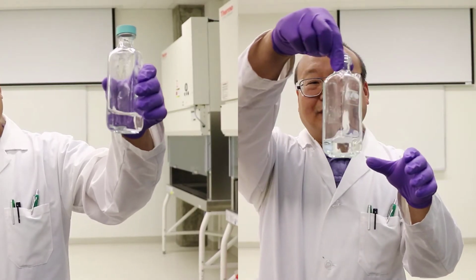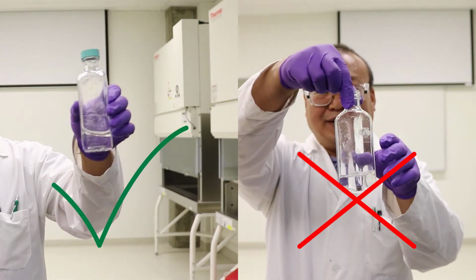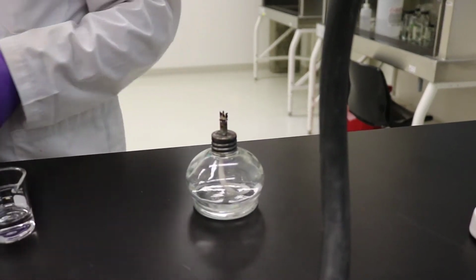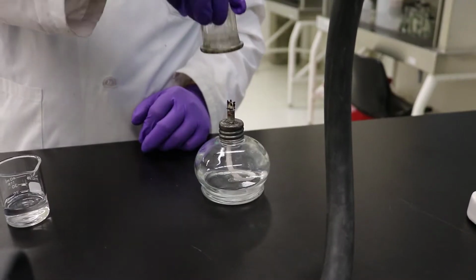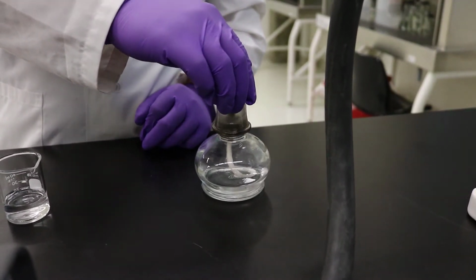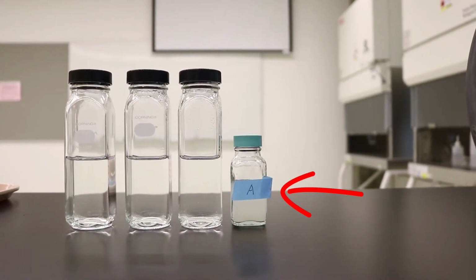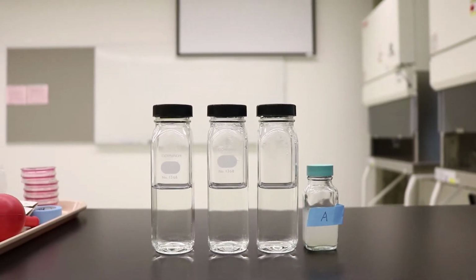Glass bottles have the potential to cut fingers. Always hold them in the middle. Be careful of the fire. Keep distance with the alcohol burner and be careful not to burn your hand and hair. Extinguish it with the cap provided and do not attempt to blow it out. Always use tape labels. Do not write directly on the glass bottles.